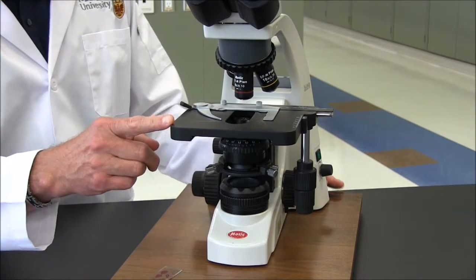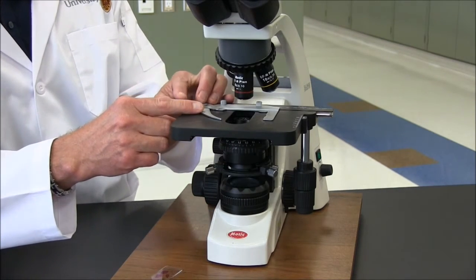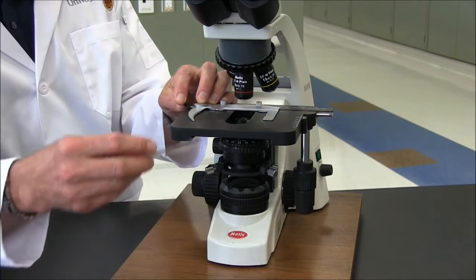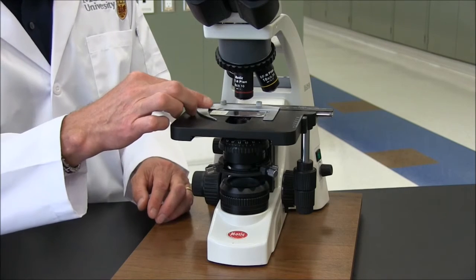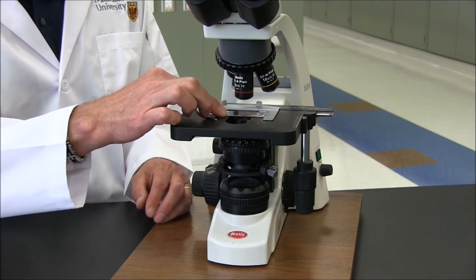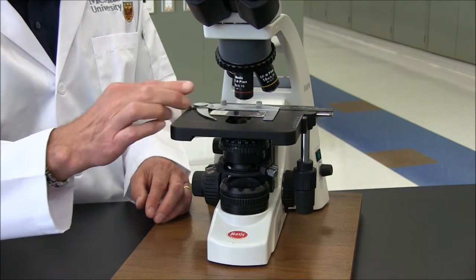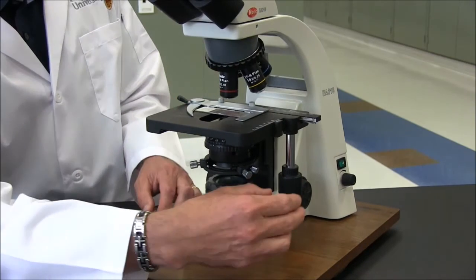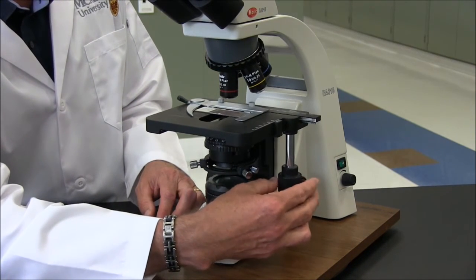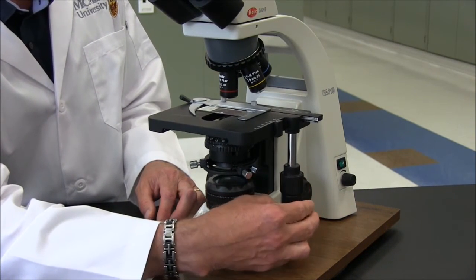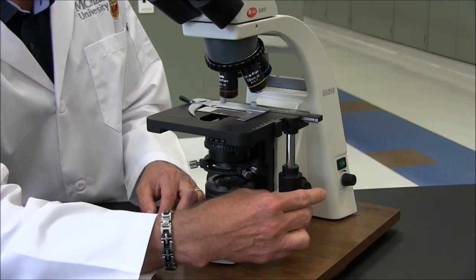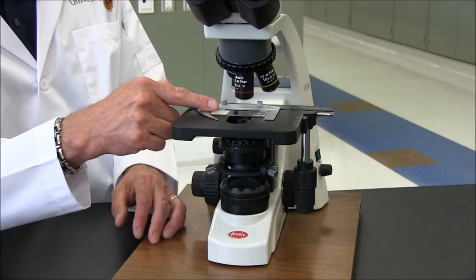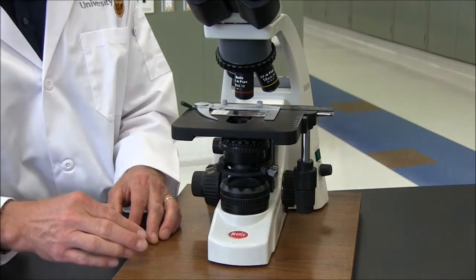This is the stage, and attached to the top of the stage is a specimen holder, which you can open up and place the slide in it, so it holds it on top of the stage. Make sure that the label is facing up and that the cover slip is facing up as well. You can move the specimen by these travel knobs. One will move it forward and backwards, and the other one will move it left and right. You want to move your specimen until it's in line with the light that's coming up through the condenser and into the objective.